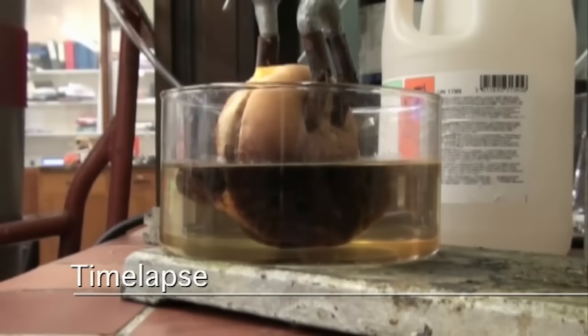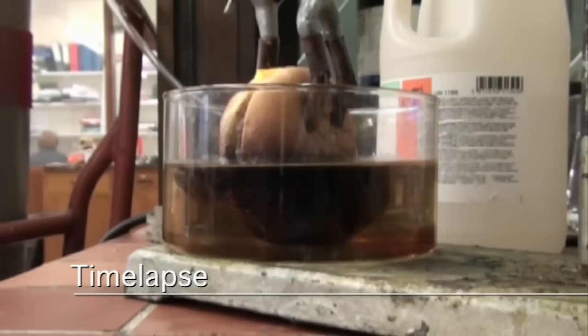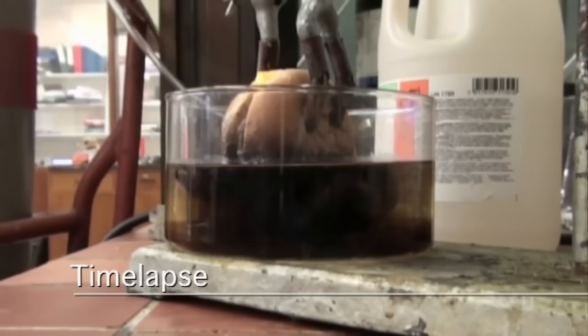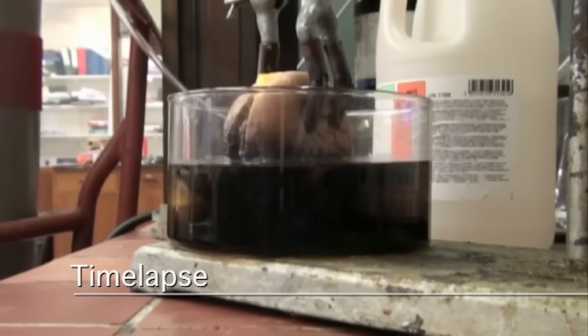It's three and a half hours. So we're gonna see what happens to a tasty McDonald's cheeseburger after three and a half hours of concentrated hydrochloric acid.